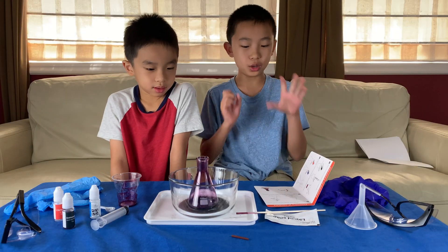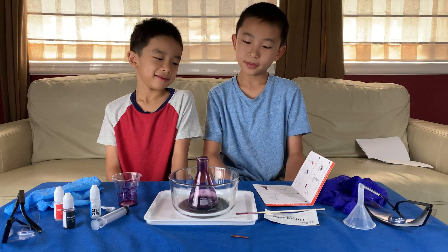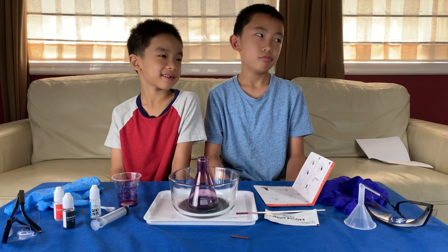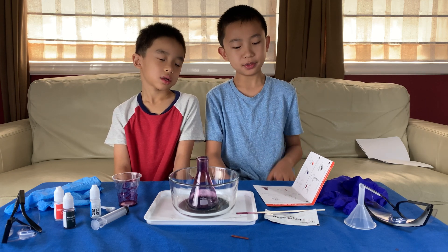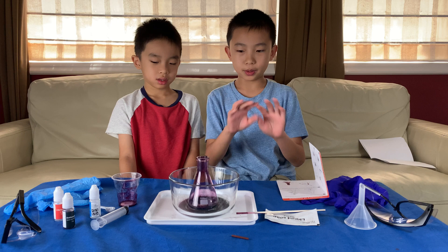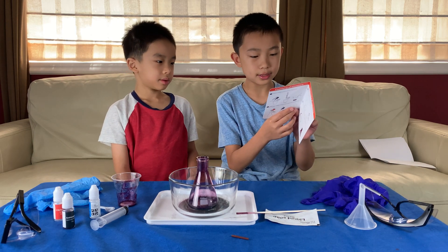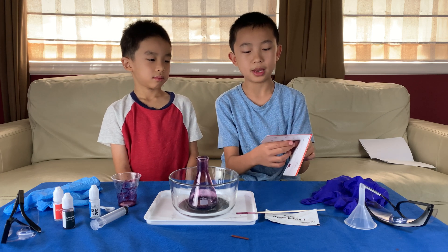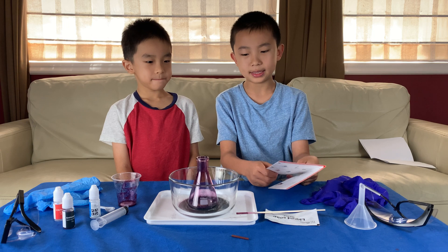The foam eruption is all gone now, and that didn't take 10 years like brother thought - it took maybe a good 15 or so minutes before it finally stopped. Now we have to dispose of the project. The instructions say: dispose of solid waste together with household garbage, and pour the solutions down the sink and wash with an excess of water.